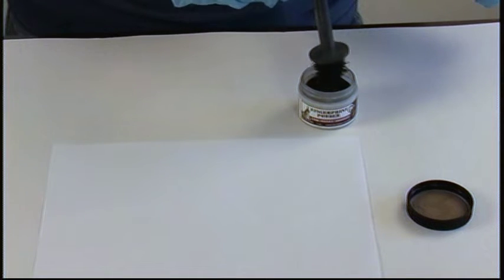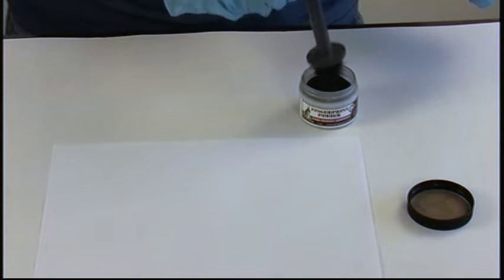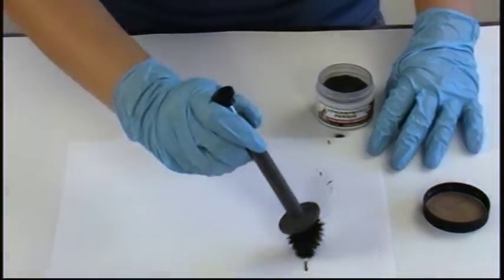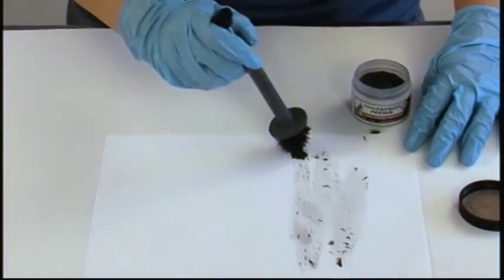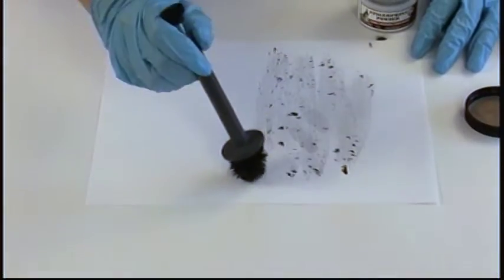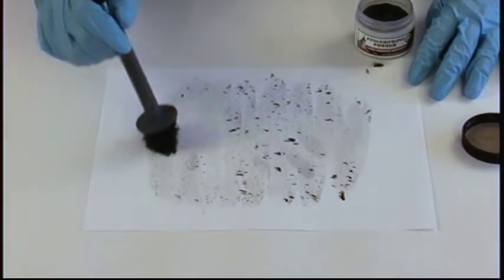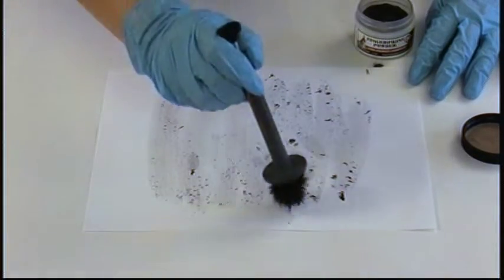You want to brush this lightly across the surface. You don't want to drag it so the base of the wand touches the paper, otherwise you can ruin your prints.